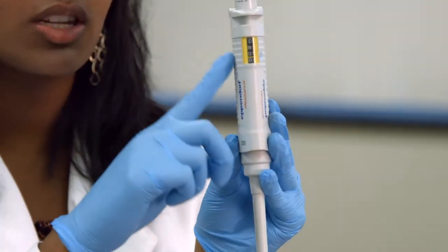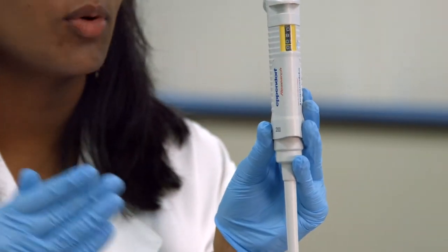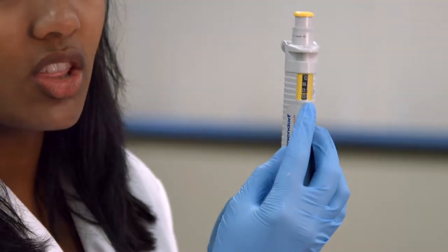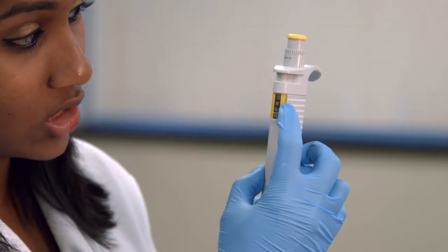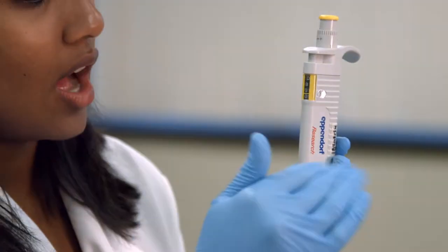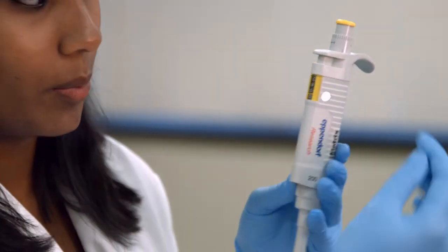But on the P200, you can also do like 80.5, 80.3, 80.2, and that's this bottom. This may look like 800, but in fact, it's actually 80.0, and that line right there in the middle is indicating the decimal point.